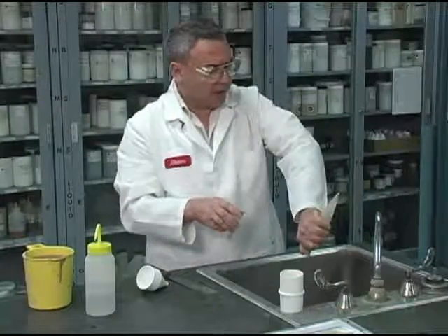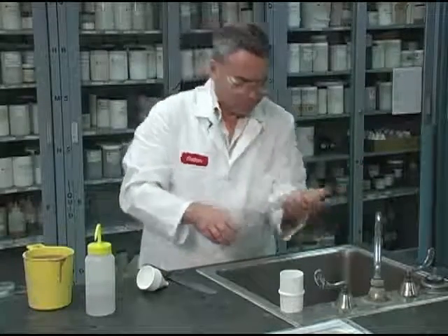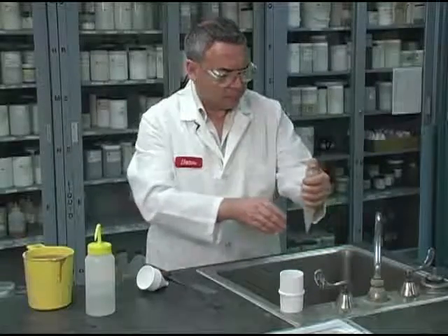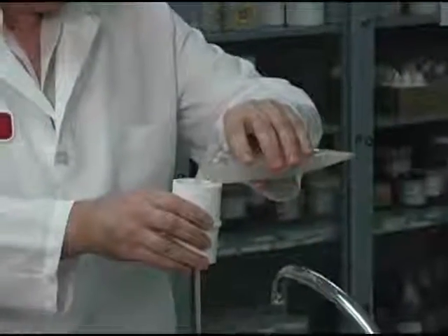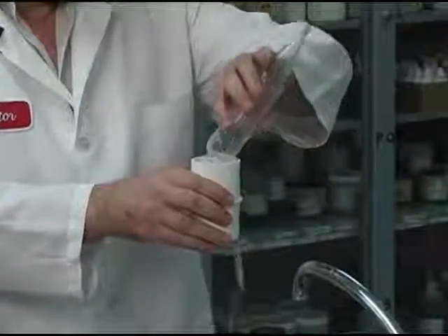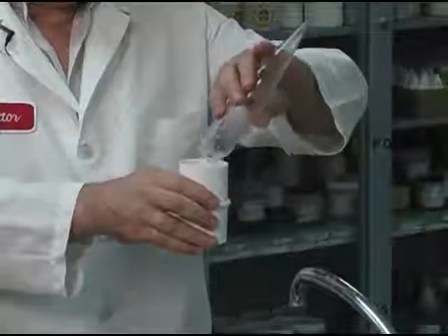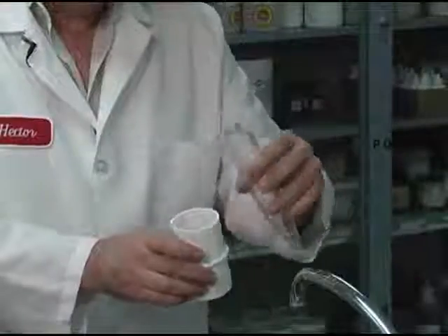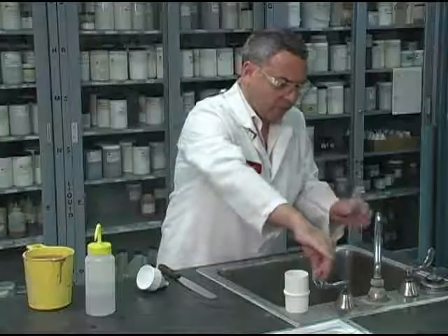Make sure that all gets out. And go again. Already see the sand that gets retained here in the mesh. One more time, or maybe 2.